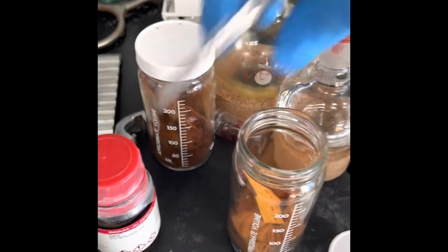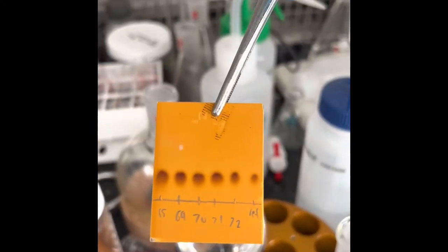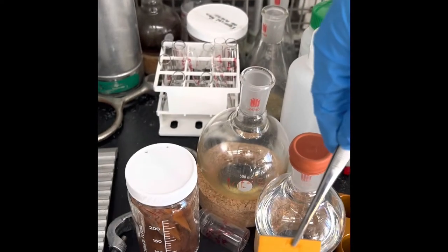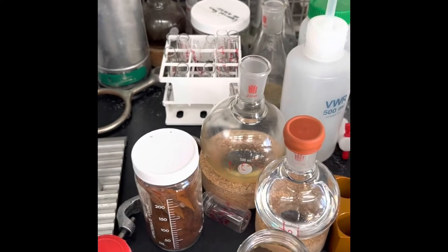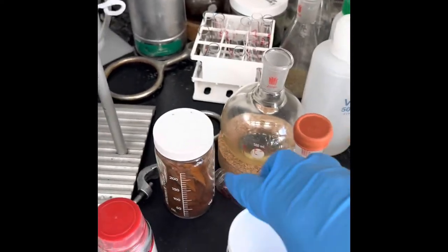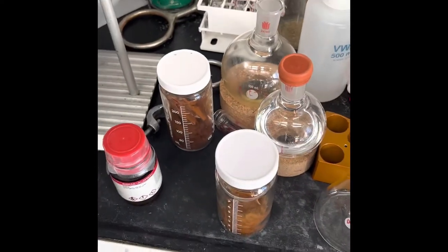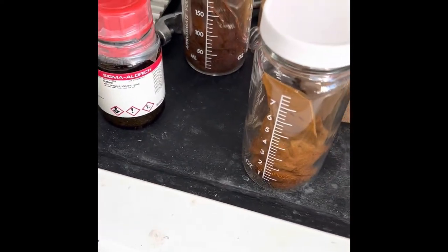Then, after some time, you can see your compound starting to stain with the iodine, especially unsaturated compounds and many other kinds of compounds you can visualize with this. So, simple and easy.